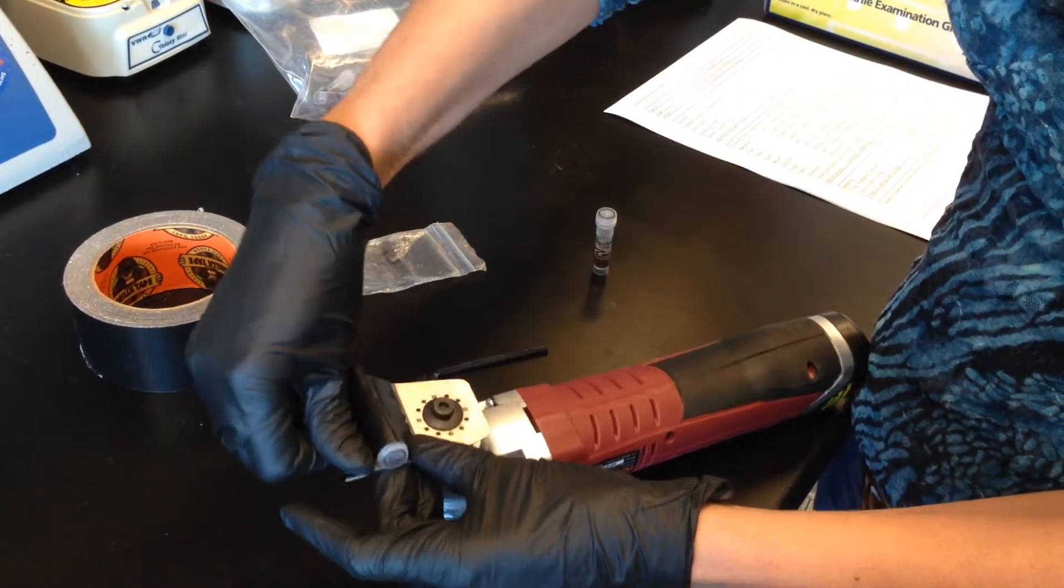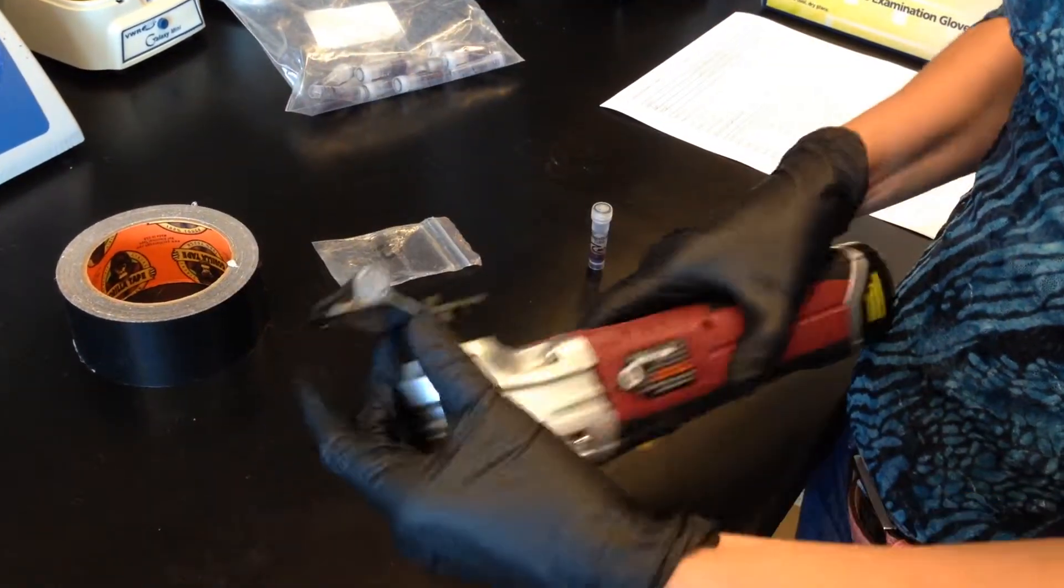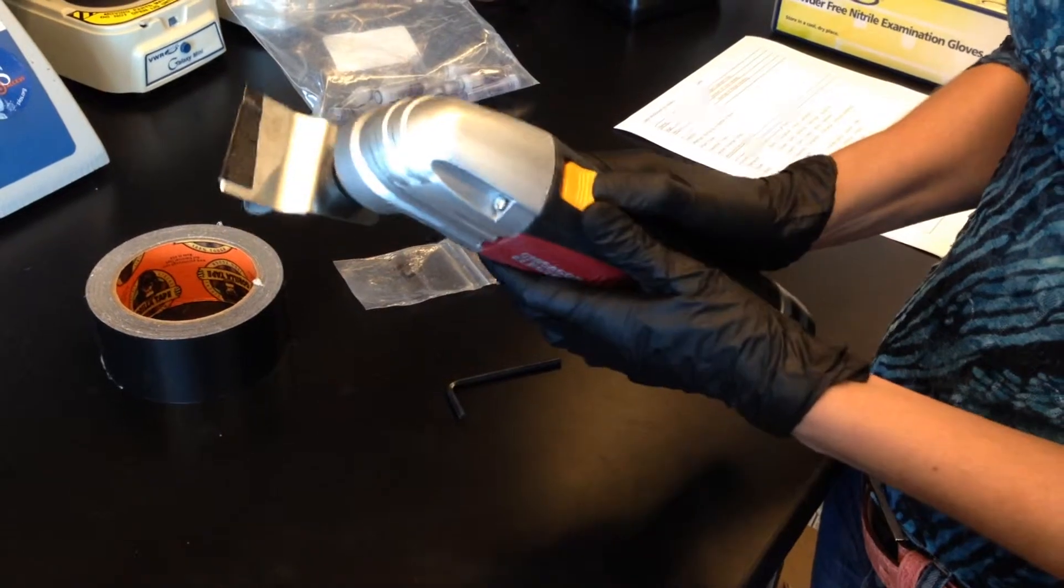You just want to make sure that the tape is on tightly, and then you just turn it on.